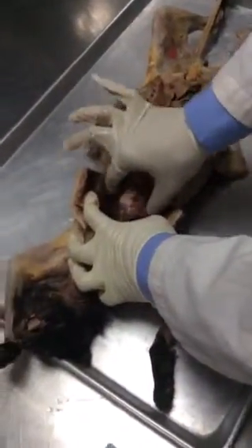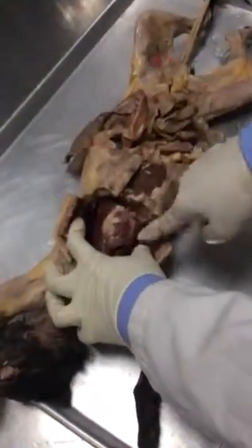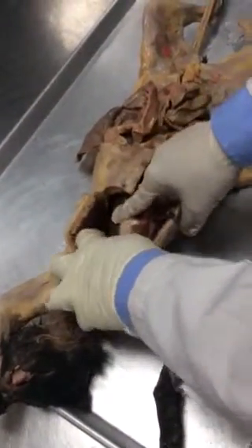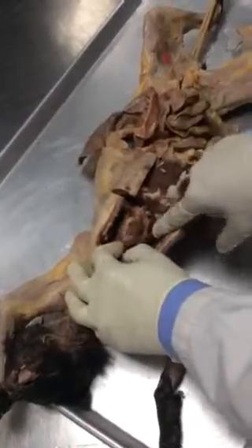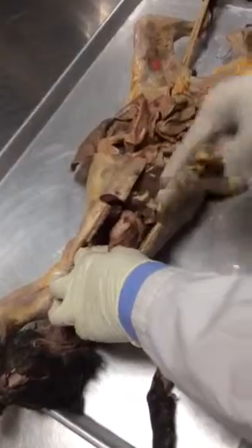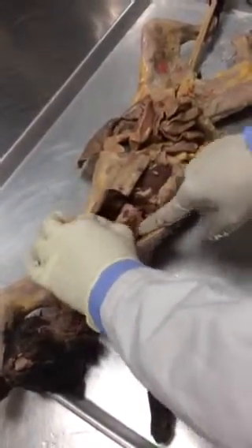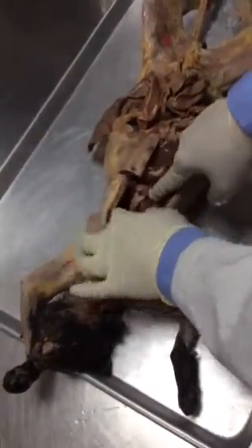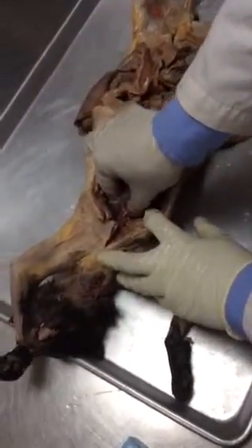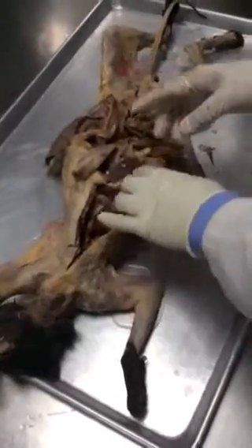So the thing is that here is the thoracic cavity. In the thoracic cavity, we have got three major structures. Two lungs and one heart, right? So two lungs you can see, and the lungs are lobulated, as you can see the lobes, right lung, left lung, and this is the heart. So next time we are gonna dissect open the heart as well. You have already dissected the sheep heart, so it's not very important. But here you see the pericardium, right? Here you see the pericardium, all the layers of pericardium. Then if you slit it open, then you're gonna see the heart. Heart is connected to some major blood vessels, and this is also not our part here. But anyway, you can dissect the thing.